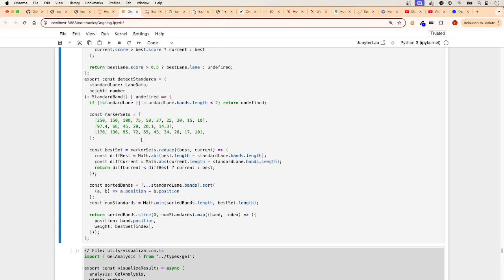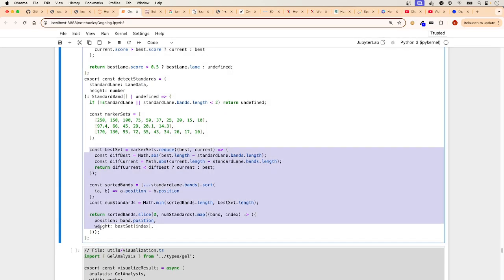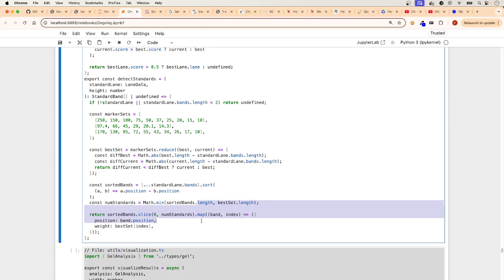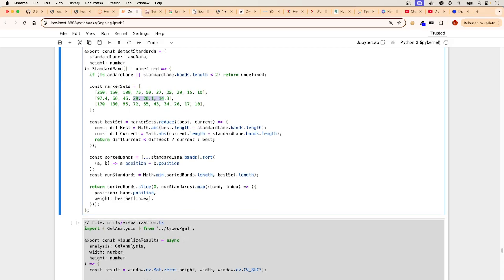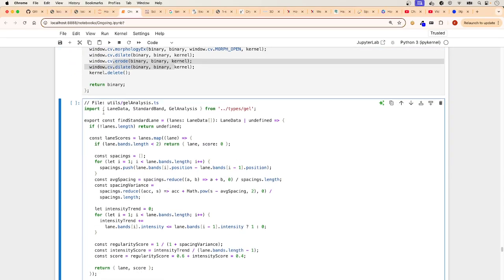Okay, we continue. Basically, what's happening here is just a sort algorithm. Once it finds the number, let's say it's 67, it's going to apply a sort algorithm, and it's going to look in the position of the range. So it's going to go here. If you're using this one, it's going to go through all of them, and then it's going to find that the range for 67 falls between 97 and 66, for example. It's just an example. And it will do it for each one. It's just a sort algorithm that we know from programming. That's all it's doing. So it's not as complicated as it looks.